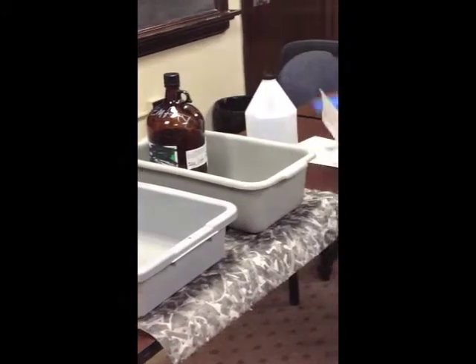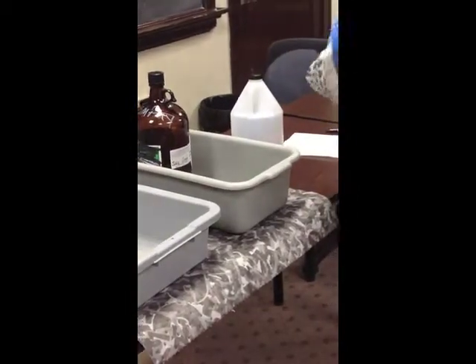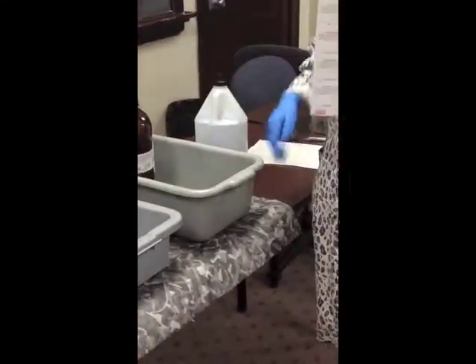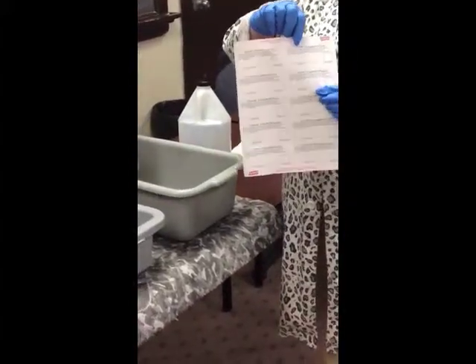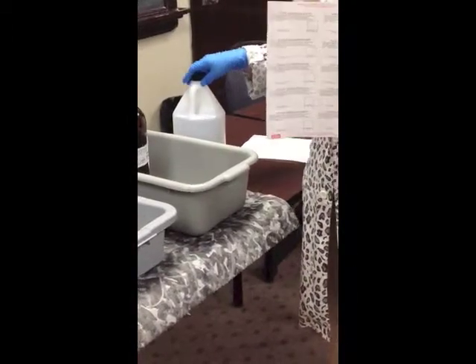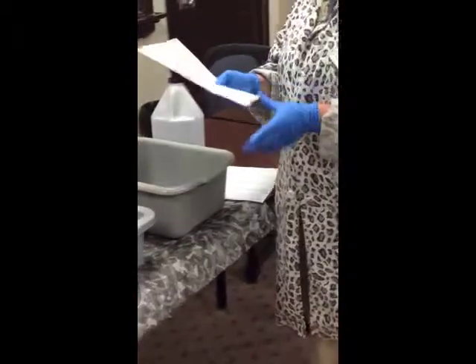Also, you need to make sure you're labeled properly. Research Safety has hazardous waste labels on our website. You can visit it and download these. This is a standard Avery label, and it has the correct verbiage, hazardous waste. All of your waste containers must be marked with the words hazardous waste. That can't be altered.